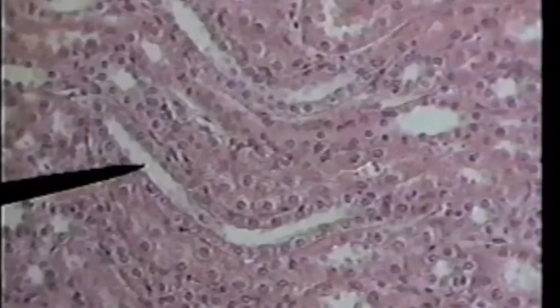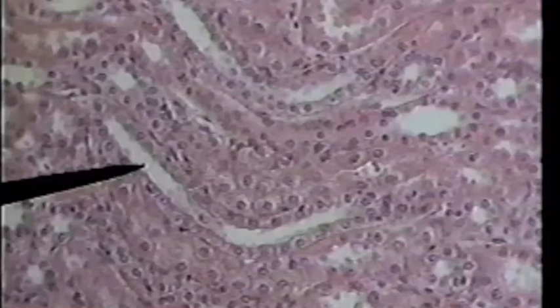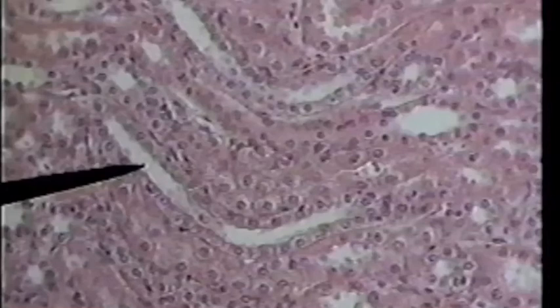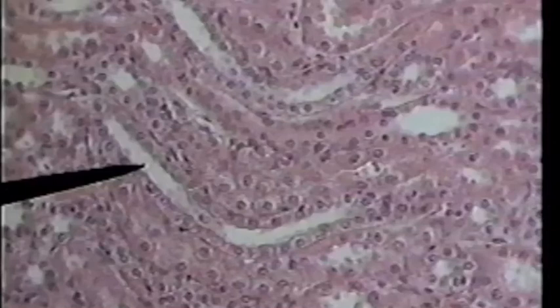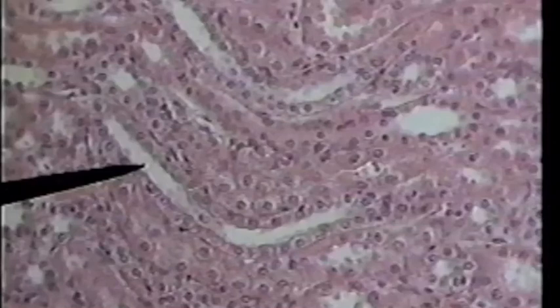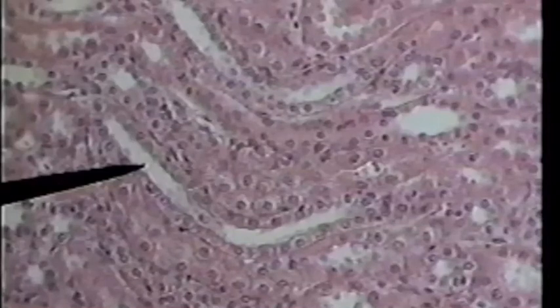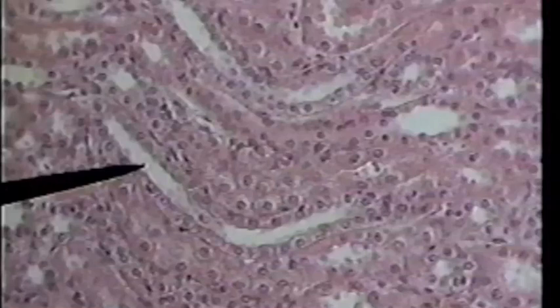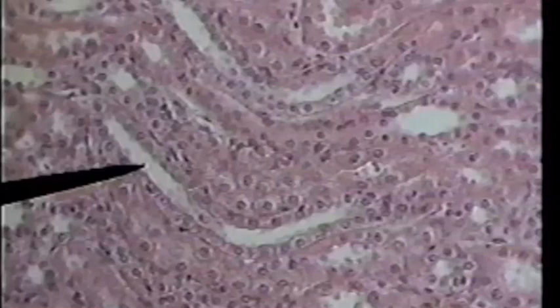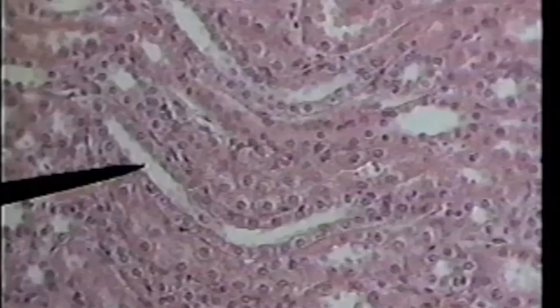This is a cut through the kidney again on high power. This time we are looking at tubules which have been cut longitudinally. The tip of the pointer is in the lumen of a longitudinally cut tubule. You can see that the tubule is lined by simple cuboidal cells.